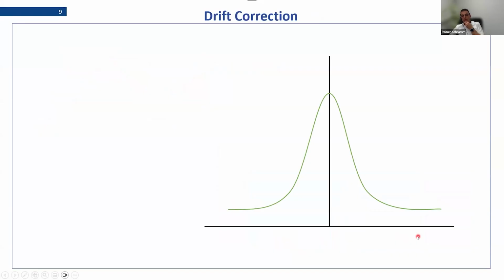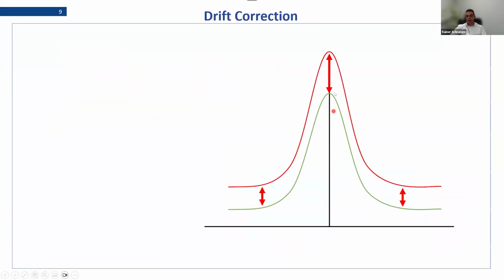Okay, but what does drift correction mean? What is changing over time? It means that the intensity of our line could be higher or lower, and the background could also change. And of course, both could change in a different way. Here you get a kind of slope, and here it's just the intensity which changes. And the reason for this is, for example, the peak positioning, what I told you already, so that if you don't do your MCA and your line positioning correctly, then your system is very sensitive to any movements.